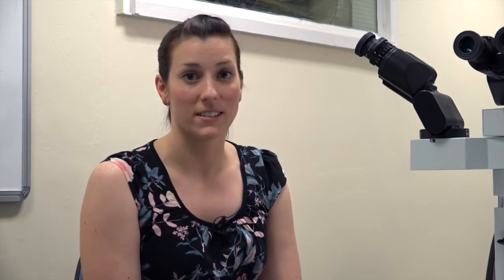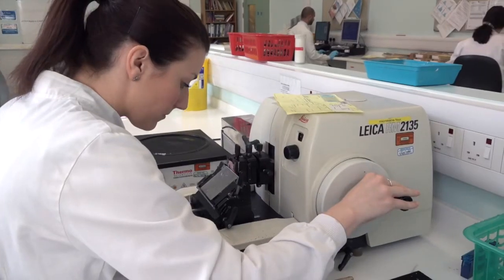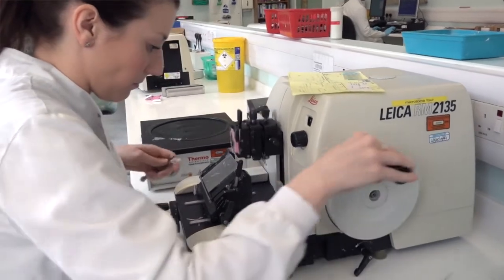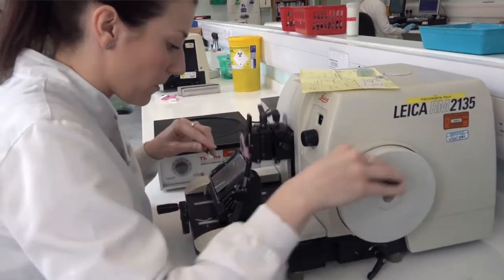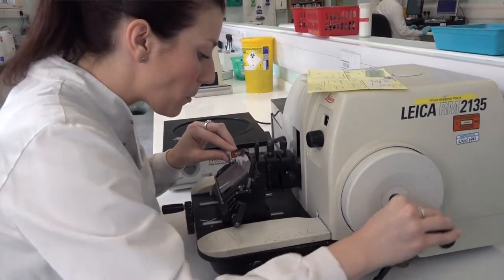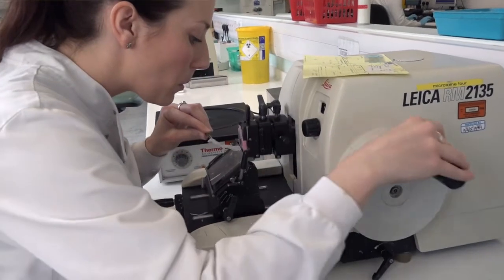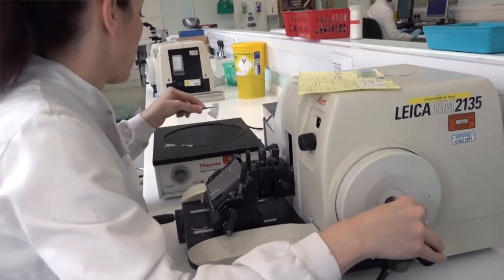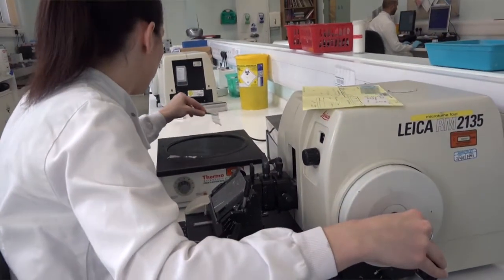These blocks are then placed onto a cold plate to solidify the wax ready for the next stage in the process. Once the tissue has been suspended in the wax it can be brought through to the main laboratory, where the blocks are cut by a scientist on a special machine called a microtome.